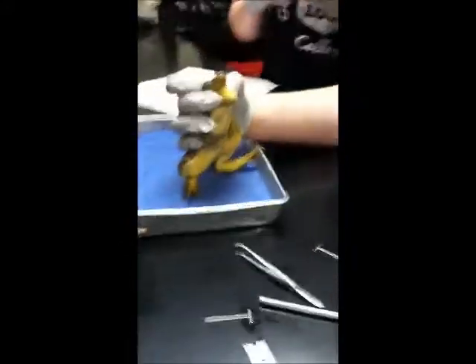This is a video. Read it slowly. What? This is a video. The pin or the nail? Oh my god, how do you do this? No — the dissecting probe. Poor thing. What's the dissecting probe?